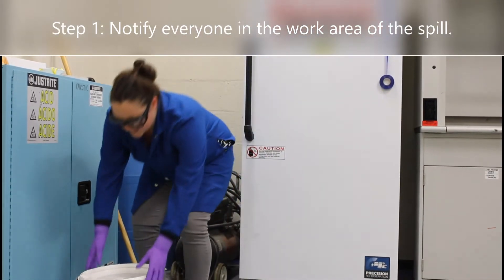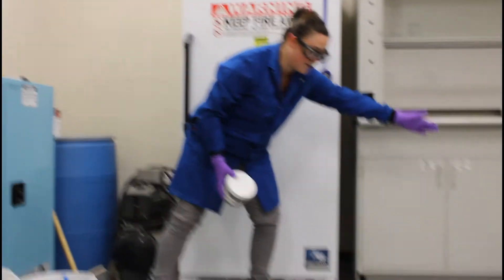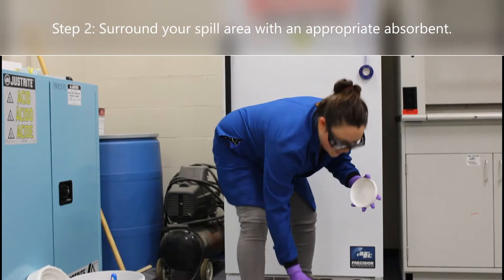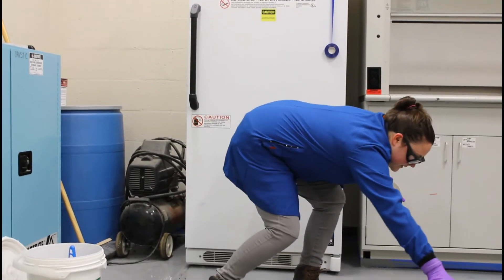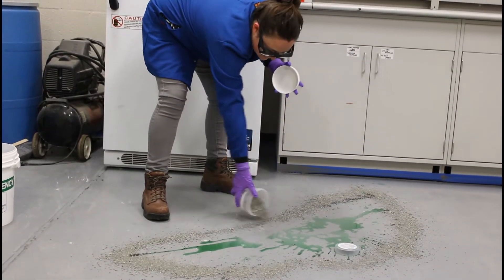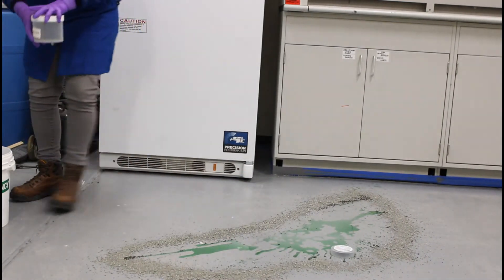Grab your spill kit and notify everyone there's a spill in the area. The first thing you want to do is surround your spill area. I have a really large area here — I'm using clay cat litter to surround my spill so it doesn't spread any further. Make sure your line around the spill area is solid to keep it contained.